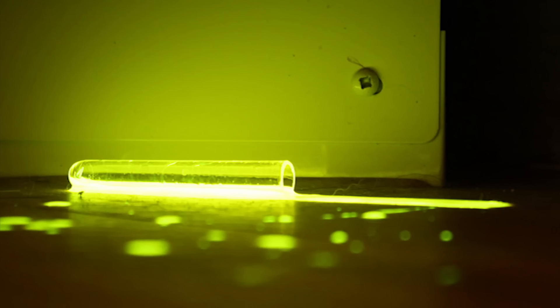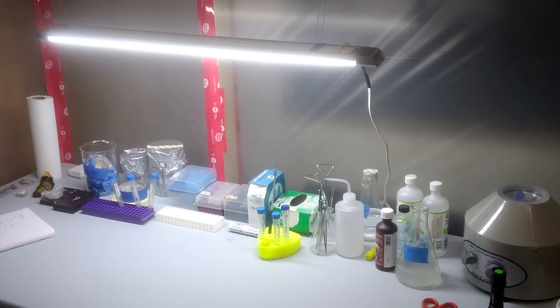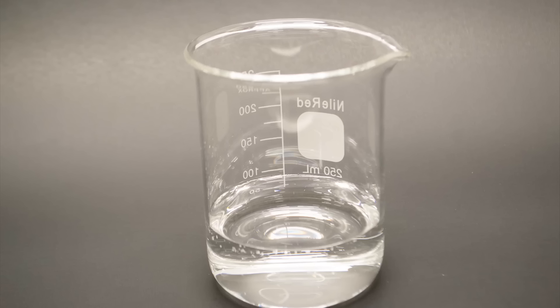Now, it's not to say that glow sticks are a particularly safe mixture normally, but I'm pretty sure that this takes the cake as the world's most terrifying glow stick reaction. I've just taken to calling it the glow stick of doom at this point. That red glow comes from a special form of oxygen that is produced in the reaction, but this is way too dangerous for me to do in my lab, so we're going to take a little trip and visit Nile Red.